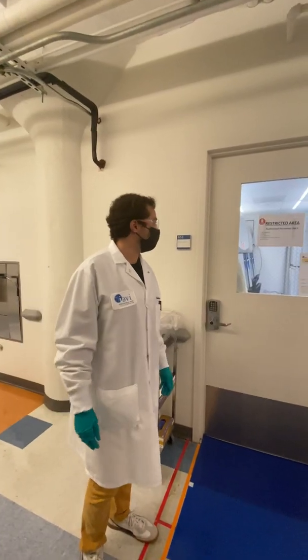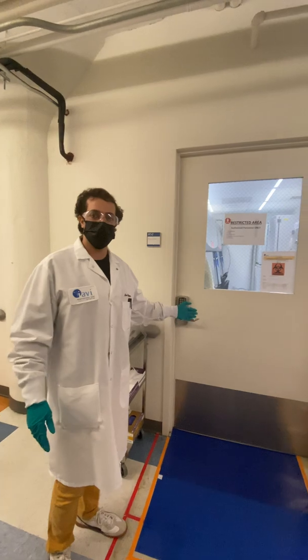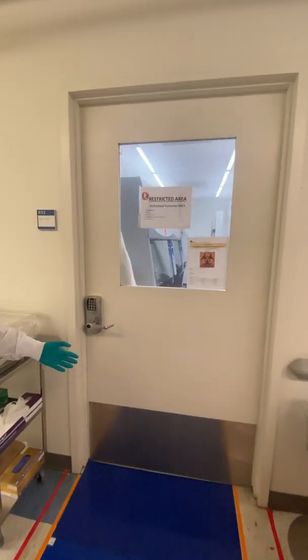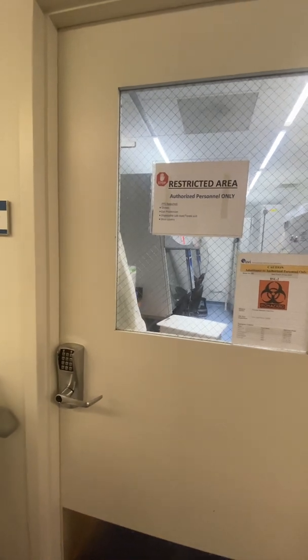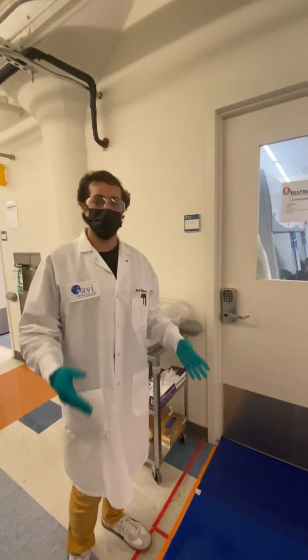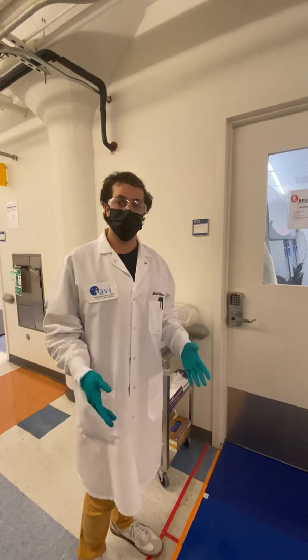This is one of our early development labs. This is one of our cleanest labs that we have here. We create our clean products in this room that will potentially go into manufacturing once we have a product that is suitable. Thanks for joining us today and I hope you enjoyed the tour.